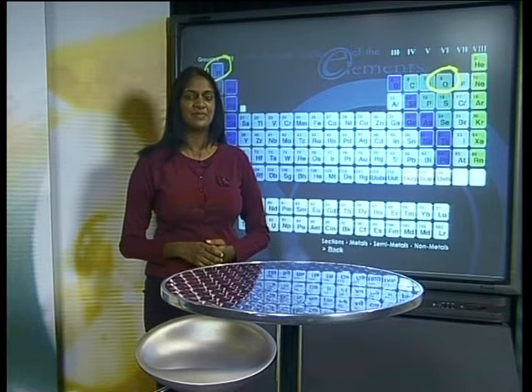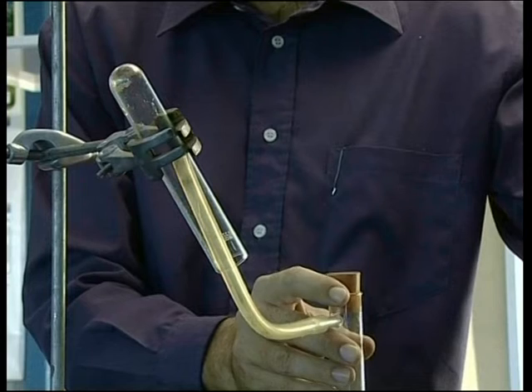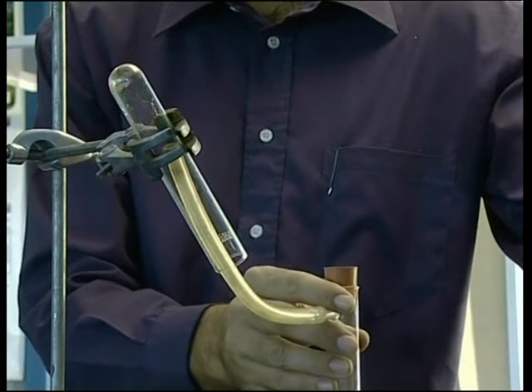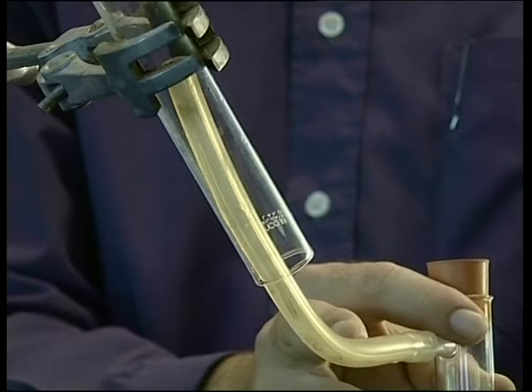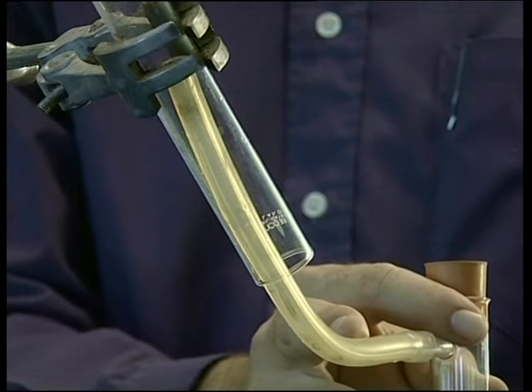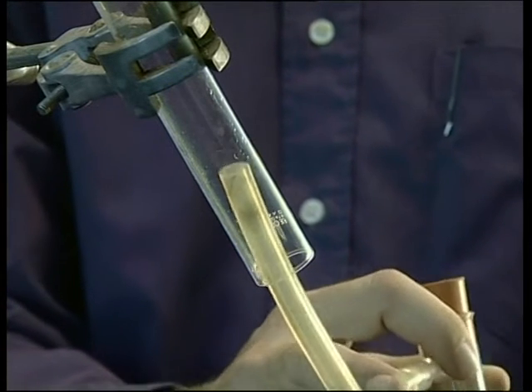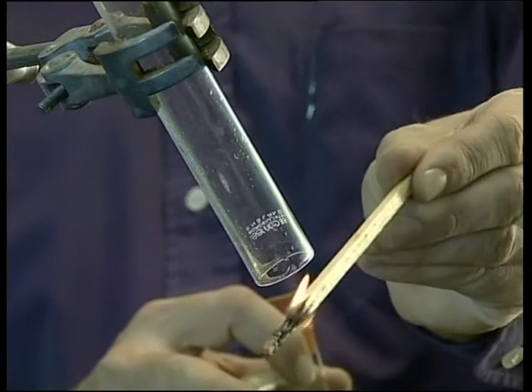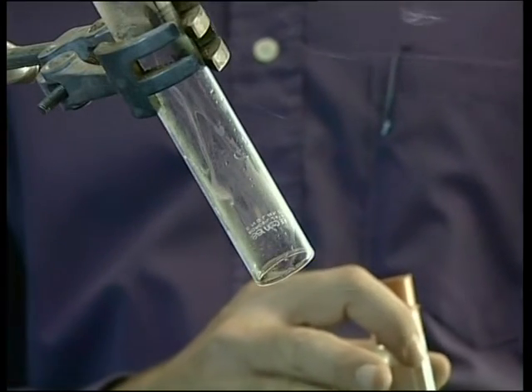Let's look at a demonstration. A test tube is filled with hydrogen gas. The test tube is then held upside down. Hydrogen is less dense than air and will rise in the test tube, which prevents it from escaping. A match is brought close to the mouth of the test tube where the oxygen in the air and the hydrogen gas mix. You should hear a popping sound.